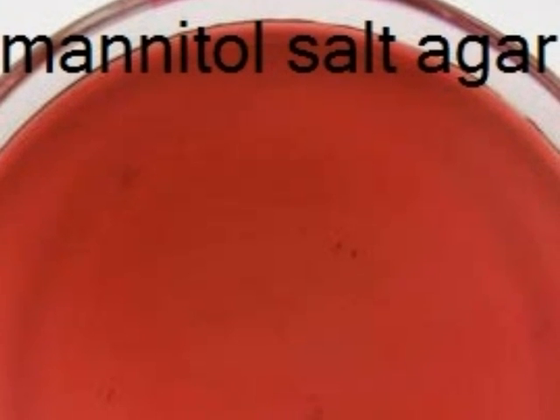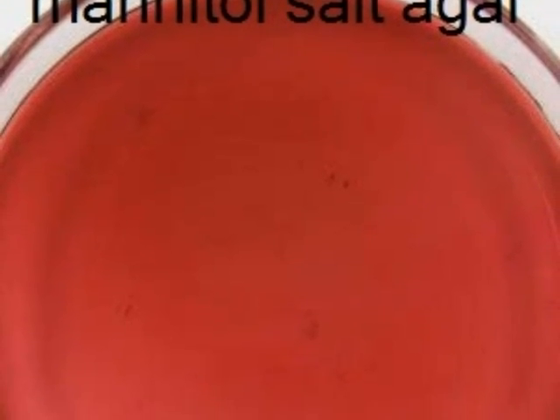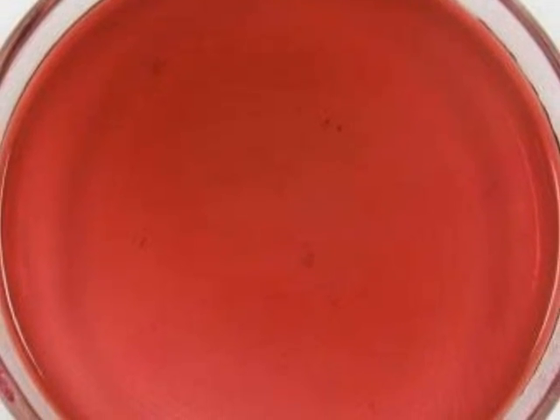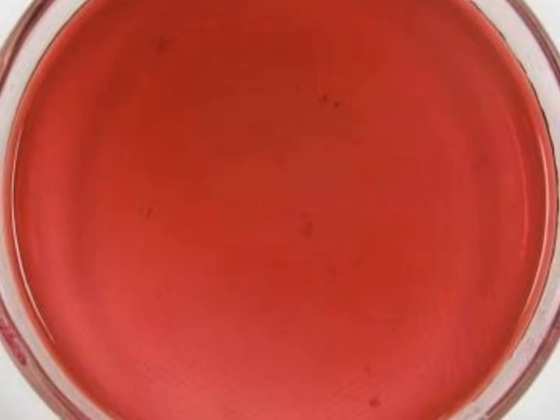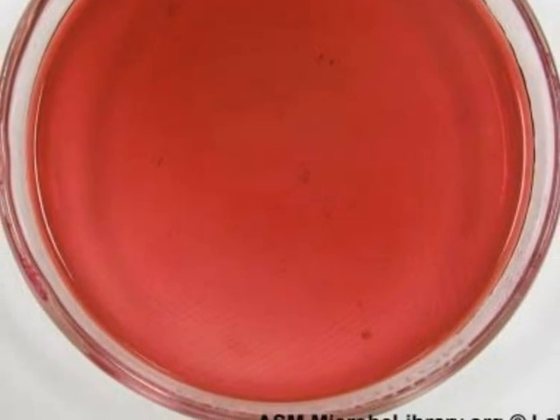In this example of mannitol salt agar, no growth is seen. If you look carefully, you will see the streaks left by the loop, but there is no growth. Interpretation would be, the microbe cannot tolerate salt and is most likely gram-negative.